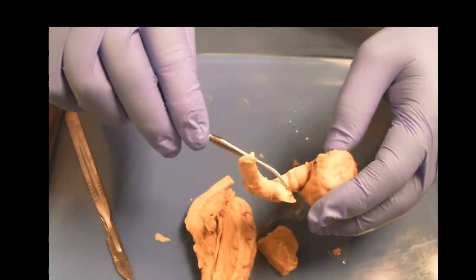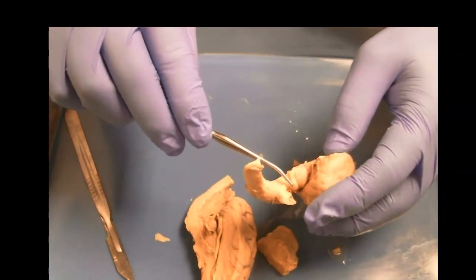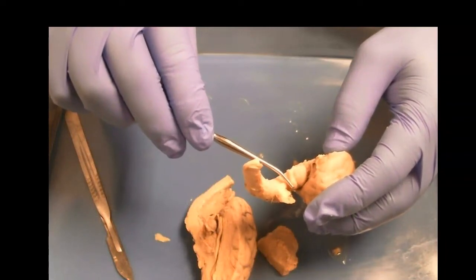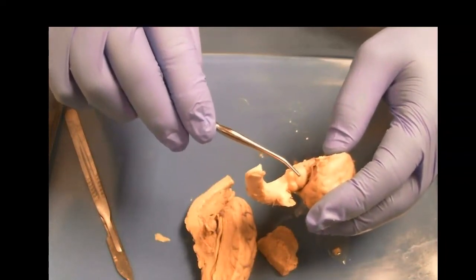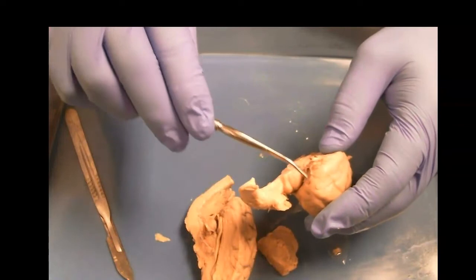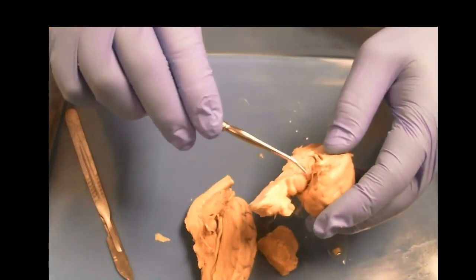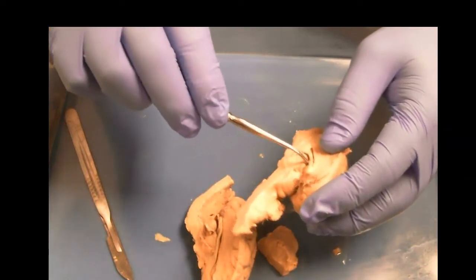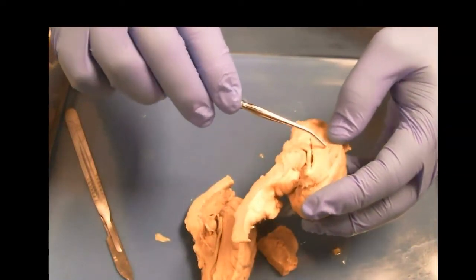And this is also part of where the inferior colliculus, you've got your auditory tract running through there. Your superior colliculus, not all of your visual tract, only part of it runs through. Your visual tract is split between going directly to the occipital lobe and then the superior colliculus doing some of those automatic visual things, again, the drawing of the attention.